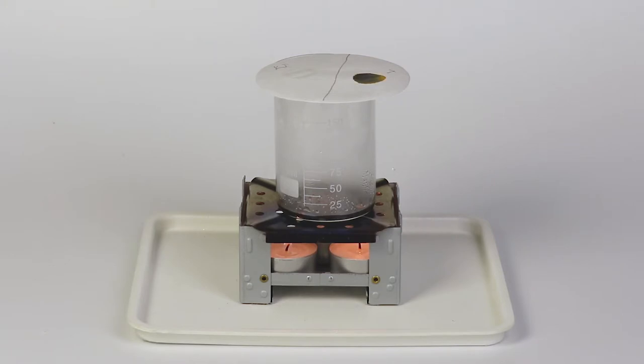Heating promotes a chemical reaction within the solution. Namely, Manganese Dioxide reacts with sodium chloride to produce chlorine. In turn, chlorine dissolves in the drop of thymol blue.